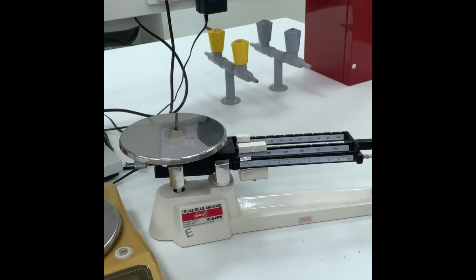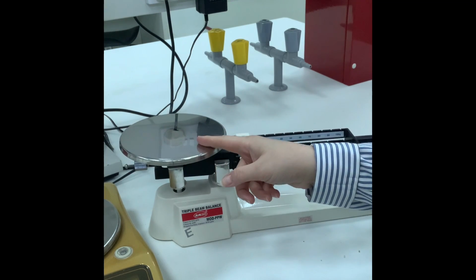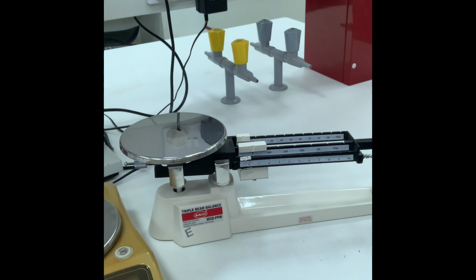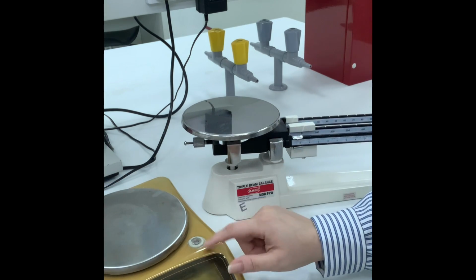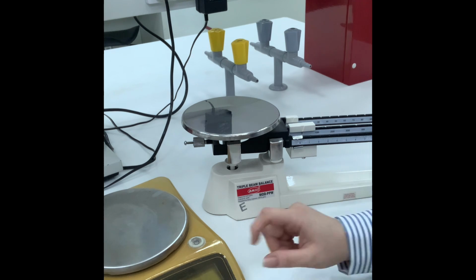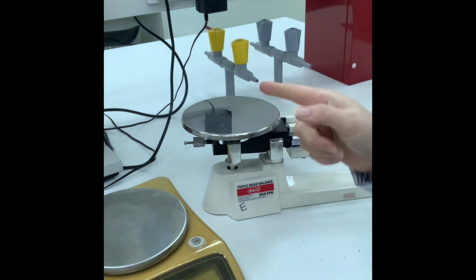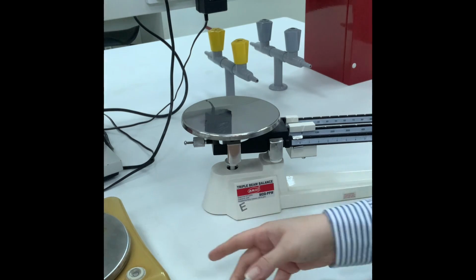So in our assignment in metric system, this is the triple beam balance. I believe that you all have seen this in one of the baqalas or cooperatives where they measure rice and sugar. And over here is the electronic balance, which is more specific. I will perform the experiment with you, I believe it's E and F in front of you. The rest you have to do back at home, which I will indicate in a minute.